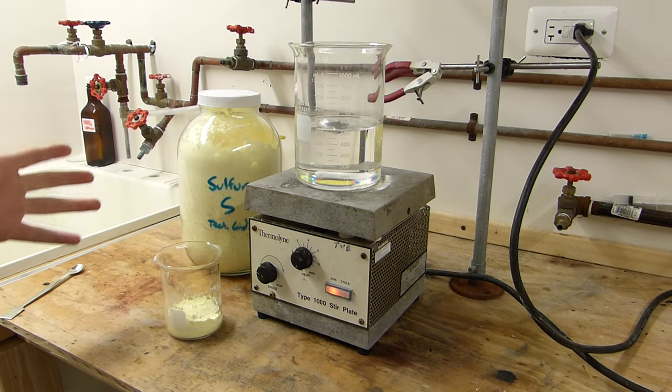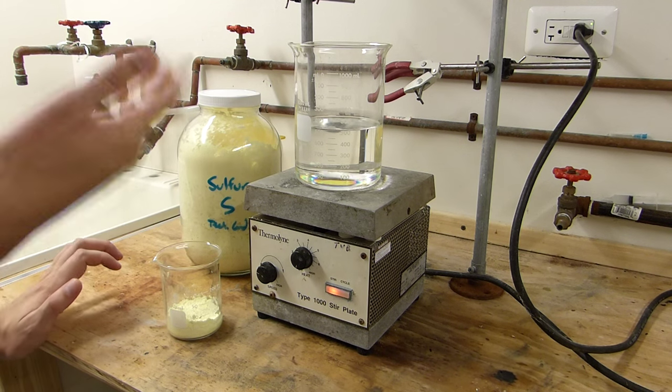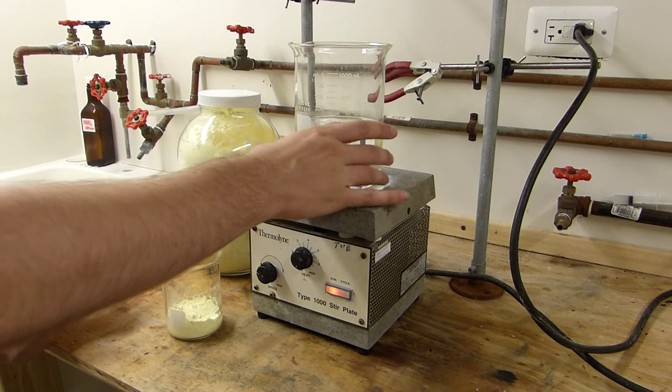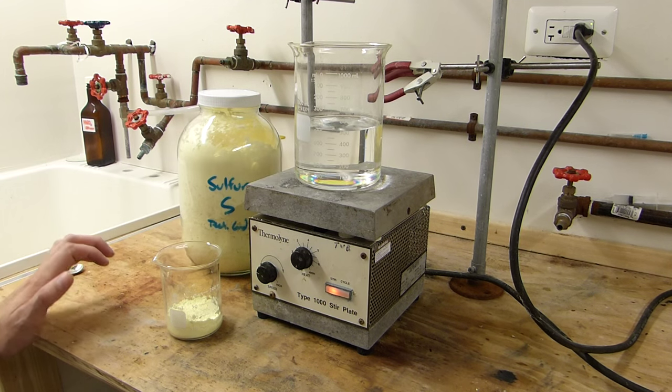You'll also need to do this in an efficient fume hood because, of course, when it's near the boiling point, it becomes quite volatile, and it's not good to be breathing in all the time. So, since this is just now starting to heat up, I will flick on the fume hood.